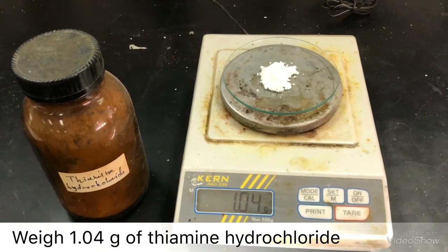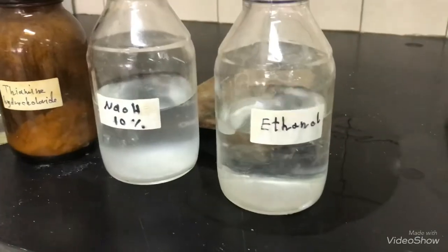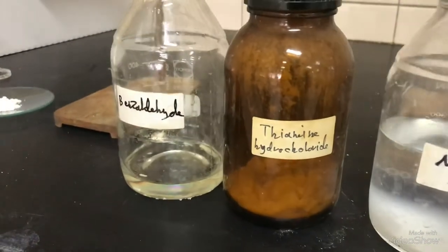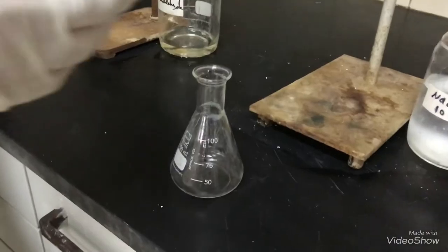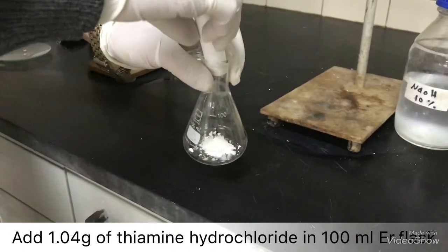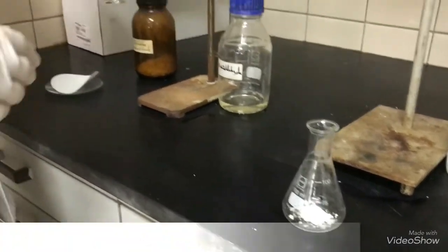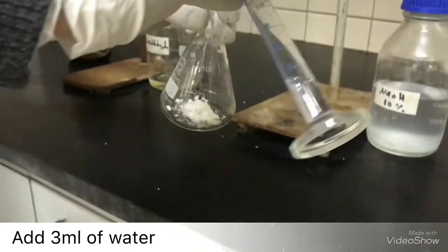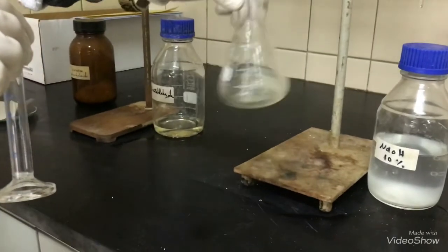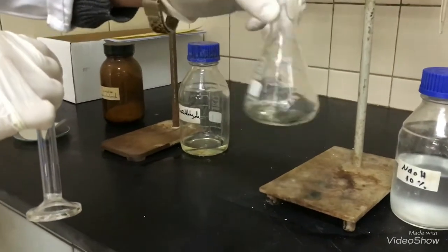Weigh 1.04 grams of thiamine hydrochloride. In a 100 ml Erlenmeyer flask, add 1.04 grams of thiamine hydrochloride. Add to it 3 ml of water. Shake well till the thiamine hydrochloride is totally dissolved.